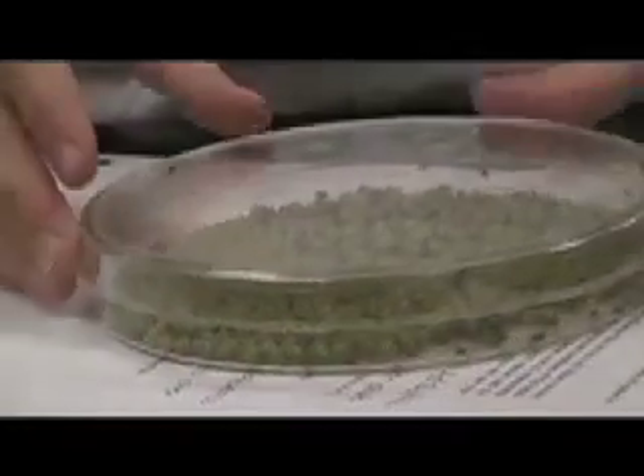Two males plus two females per plate. If they're in the process of doing it, should we not pick those? Two females in each one of your little plates. Are you ready? They're all on the top. Don't let any escape — watch the sides of your plates. Can you just go into the side? There's some on this side too. Can you just lift one side up? There we go. Just flick on the thumb. That hurts.